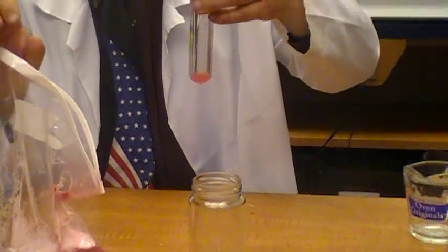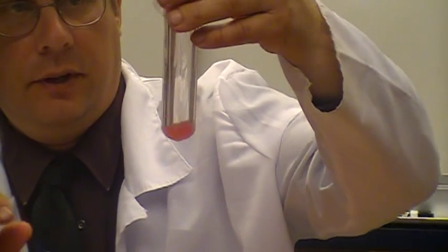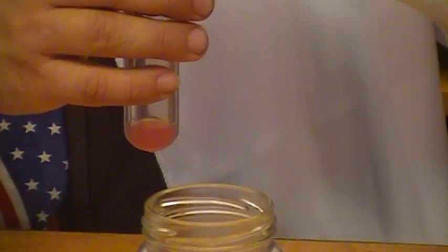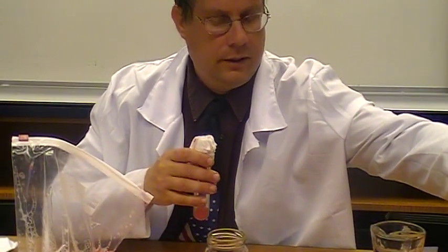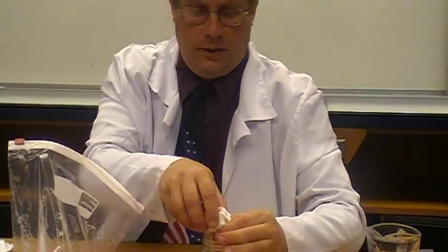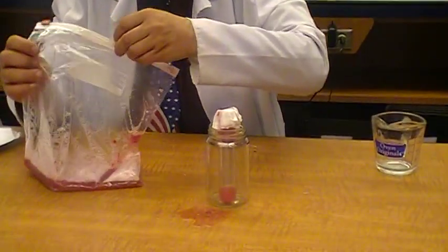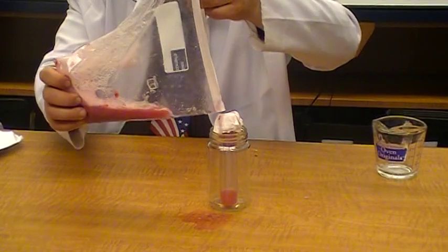Spilled a little bit. And try to allow it to filter through as much as we can. We're trying to get as much of this juice as we can. So let's see what I can do here. Okay. Alex, can you hold this over your desk real quick? And I'm going to just try to add some more lysis solution directly to the filter paper. Some more of the lysis solution slash strawberry juice.